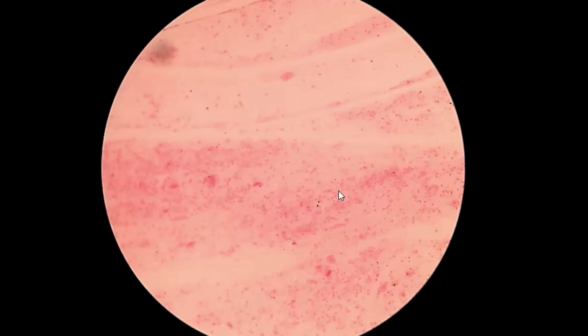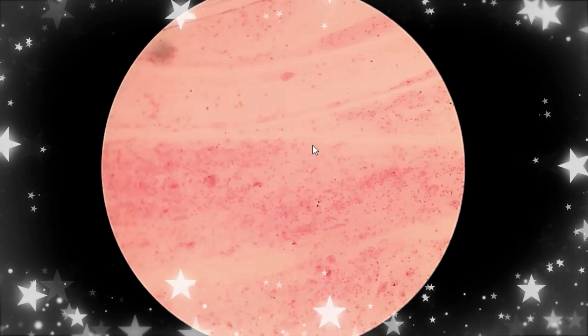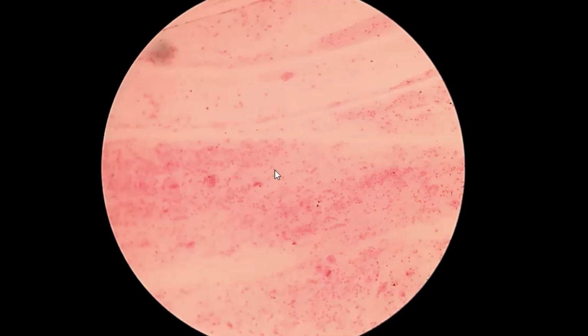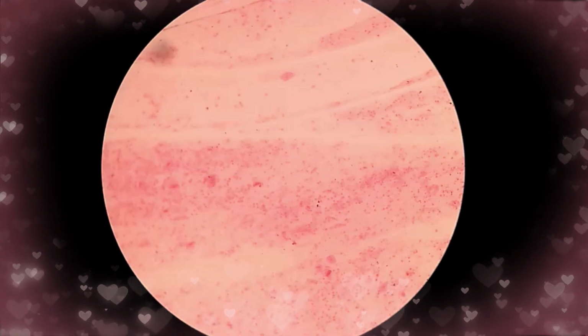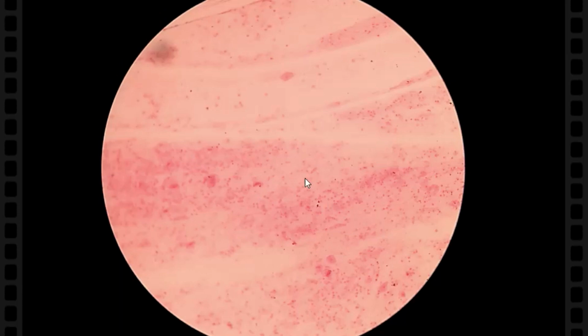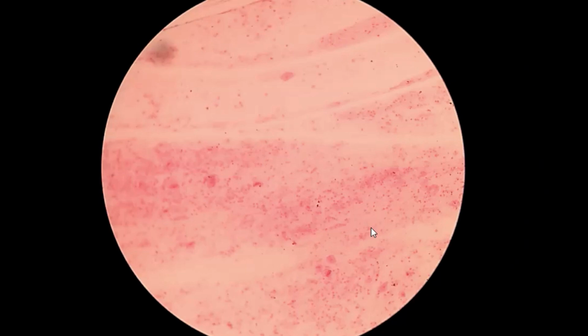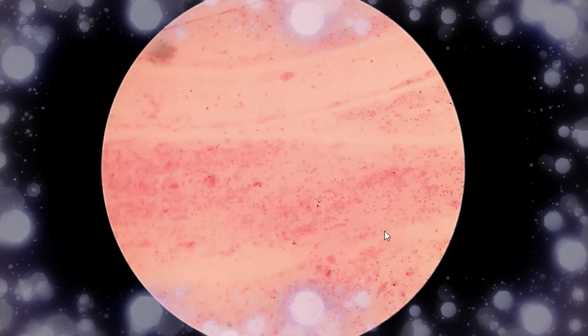which would make the specimen unsuitable for culture. If the pus cells are less than 25 and epithelial cells are greater than 10 at low power, then it will not be accepted for culturing the sputum specimen.